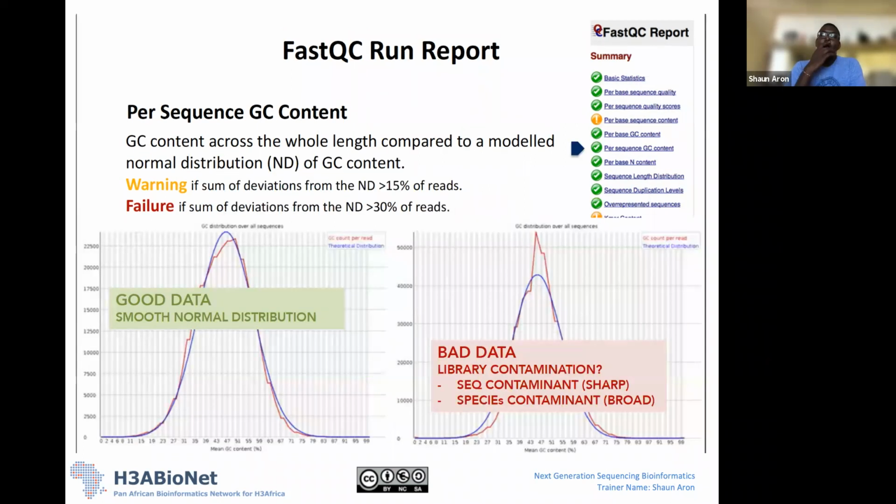Okay. The next metric that we'll have a look at is the per sequence GC content. So this is the percentage of Gs and Cs across the entire length of your reads. And what FastQC does is it compares it to a normal distribution. The normal theoretical distribution is shown in blue in the graph. And your actual GC content will be plotted in red.